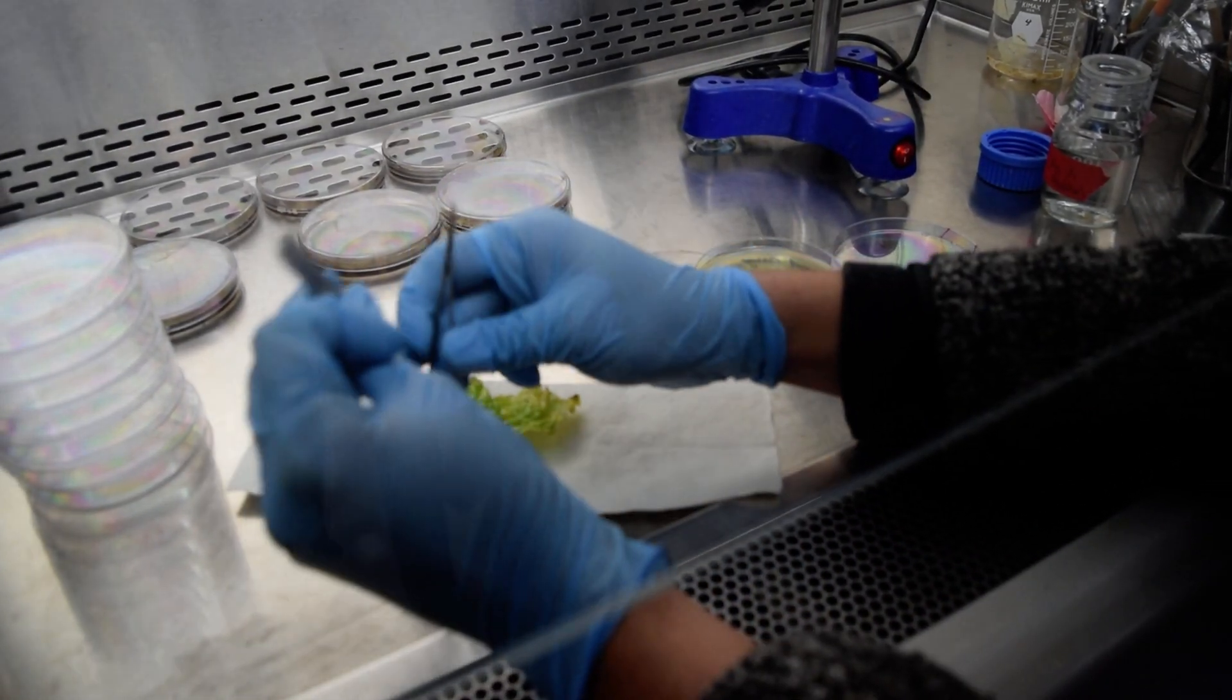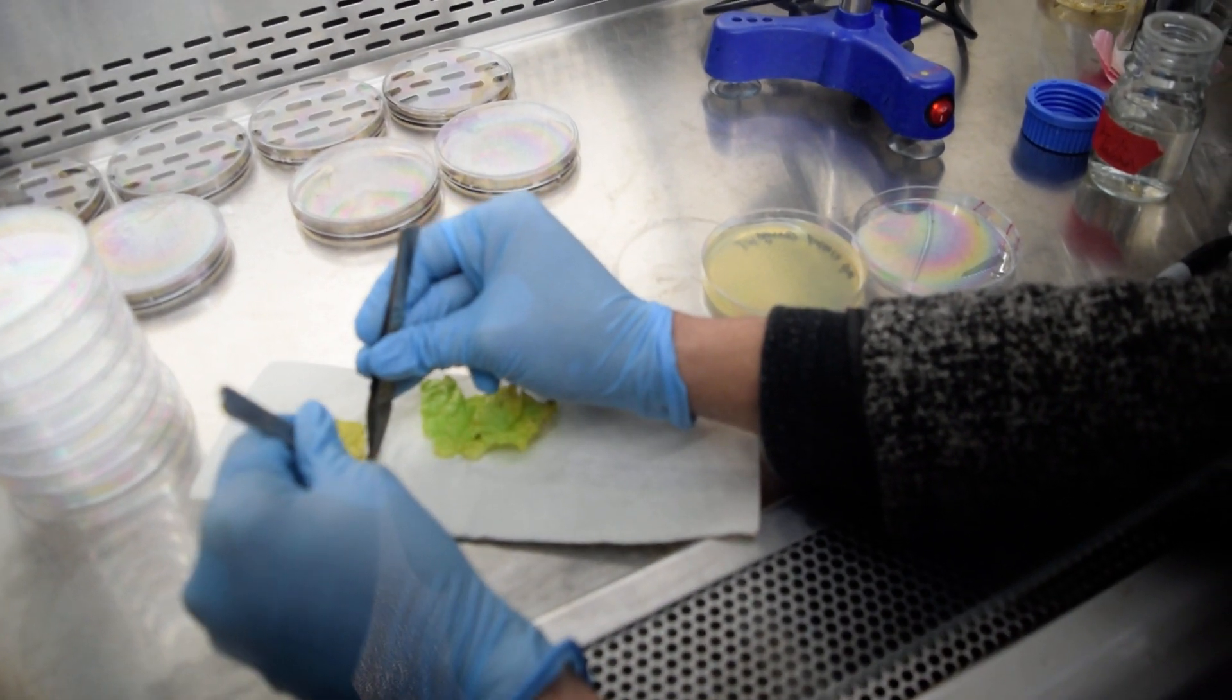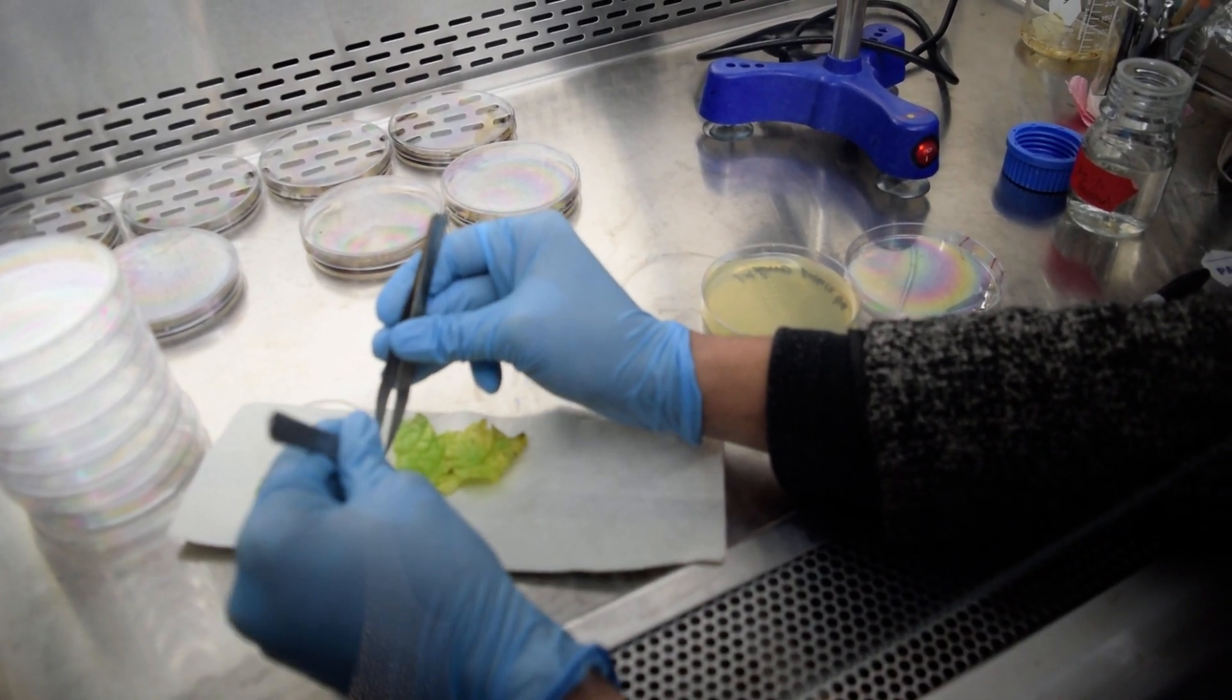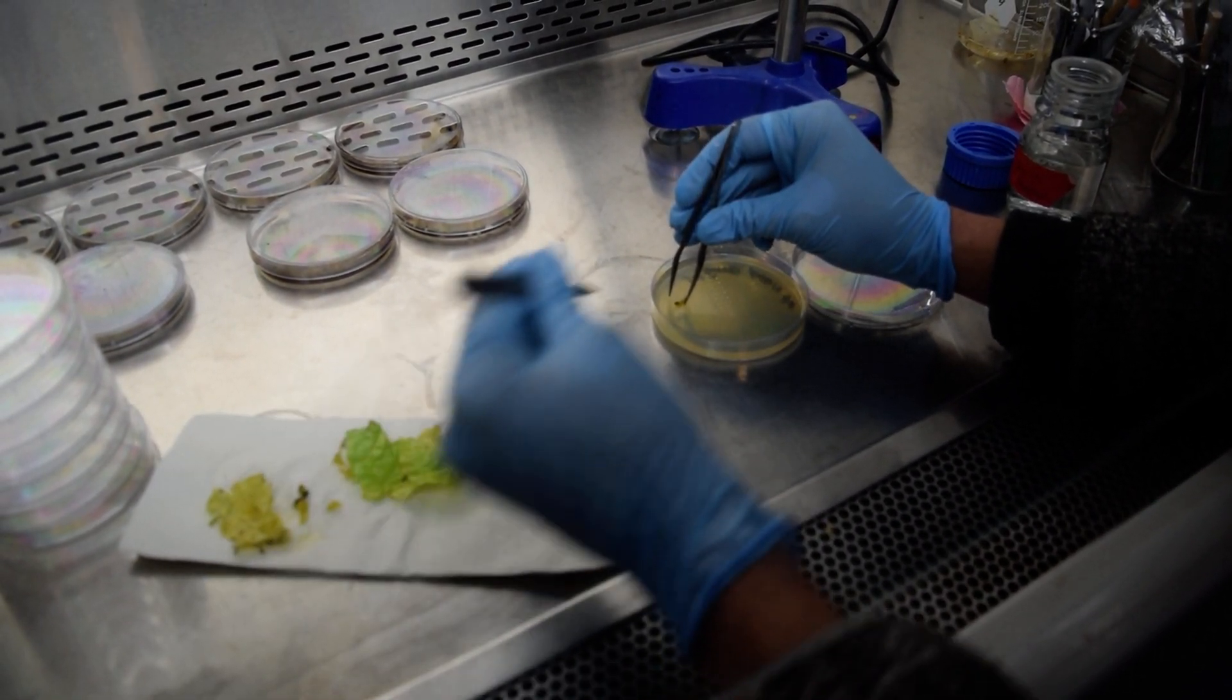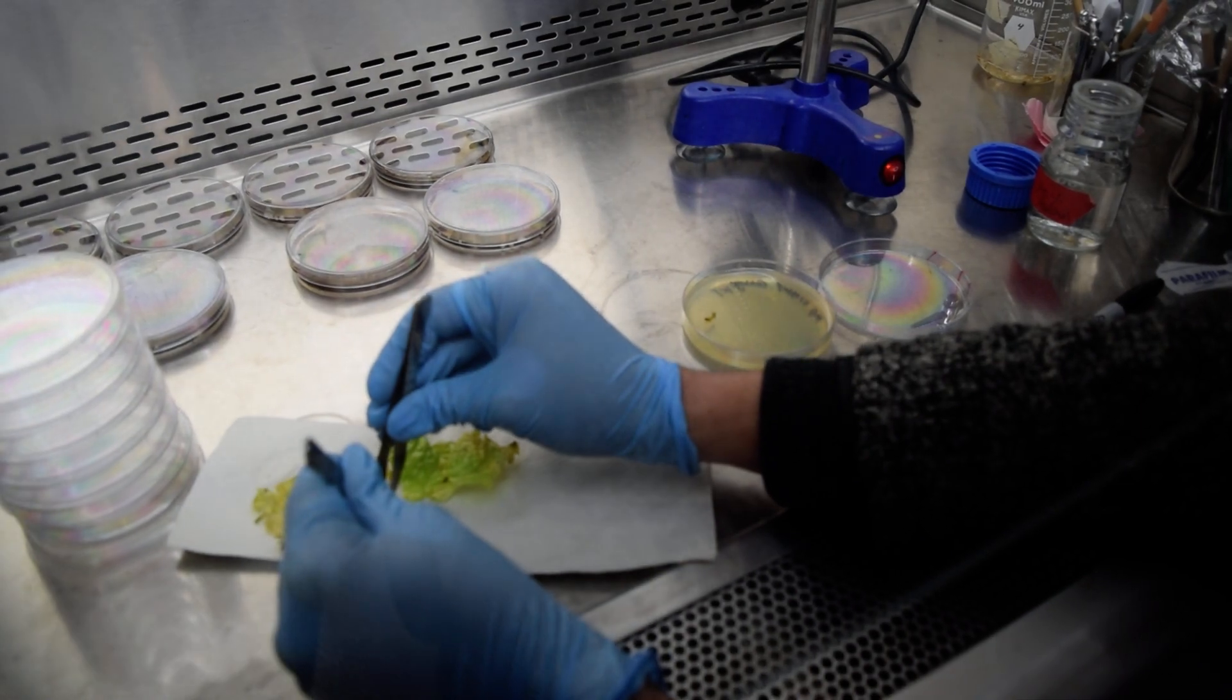After cooling, we cut the diseased sample parts into small pieces and transfer these into the medium. This is the potato dextrose agar media.